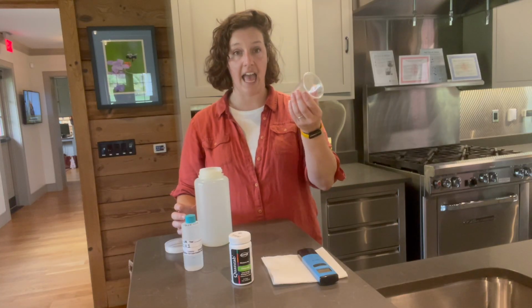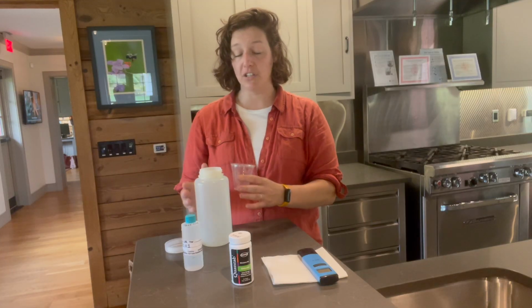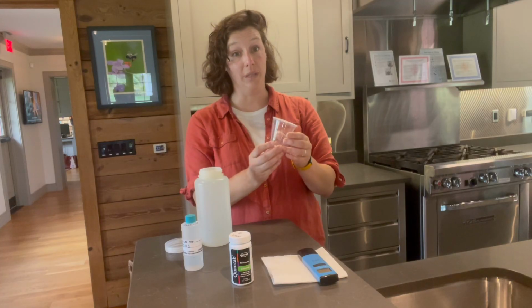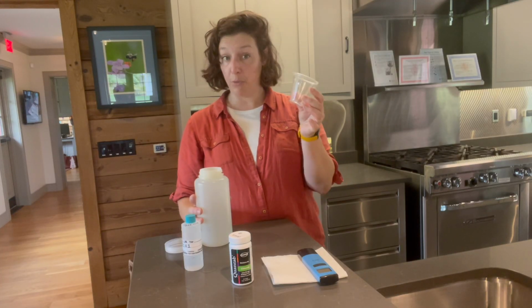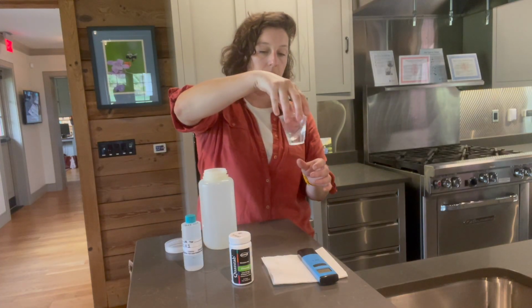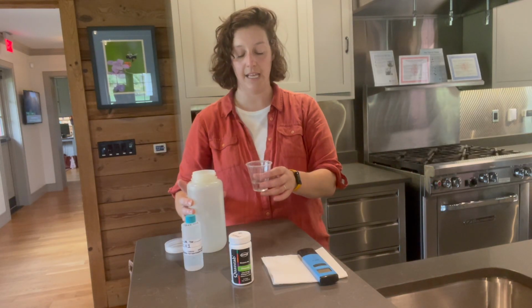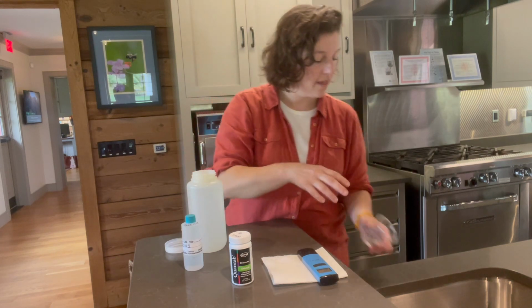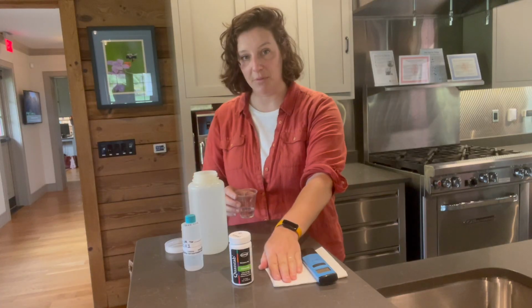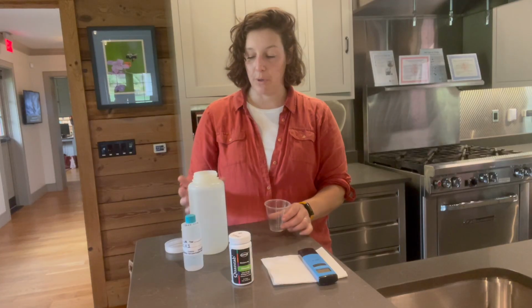So we have a cup. It's not a special cup, it's just a plastic cup. But much like the process of collecting the sample, we want to be sure that we're analyzing stream water only. So we will be triple rinsing our cup with our stream water. So I pour maybe 1/3 to half of the cup full of water from our site, give it a swirl, and then dump it out. And if you're like me, I always like to keep a lot of paper towels handy because I tend to spill during this step.